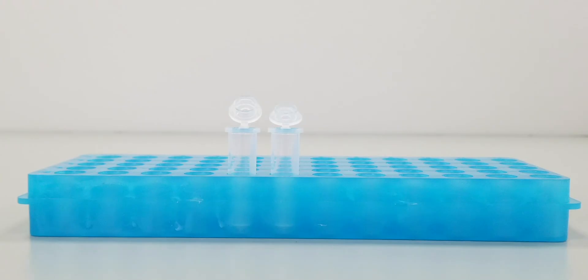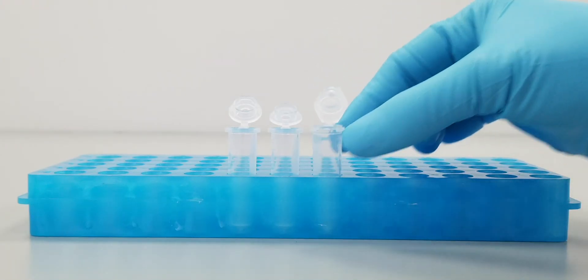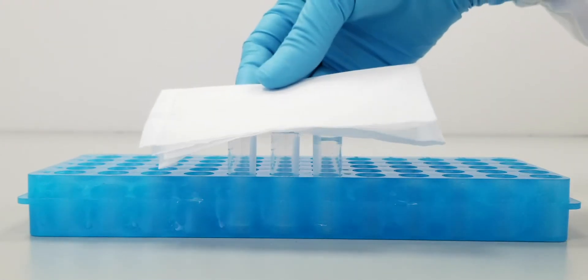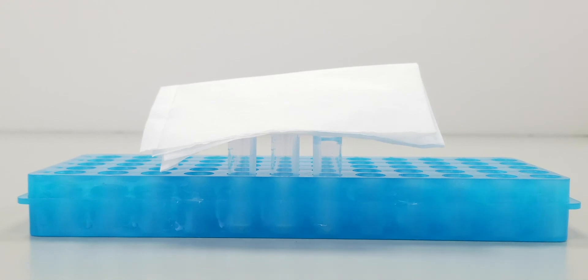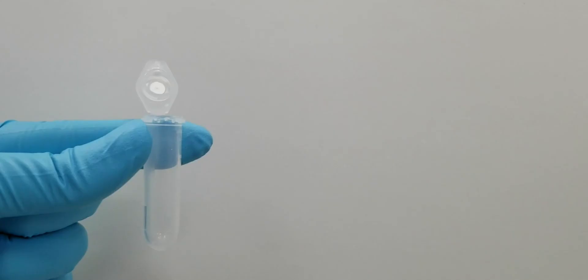Since this is the last wash, use a fine pipette tip to remove all of the supernatant. Cover the tube and let dry at room temperature for at least 10 minutes until the tube is completely dried. Note that any remaining droplets will inhibit downstream analysis. Ensure the pellet is fully dried and no droplets are visible in the tube and around the pellet before resuspension.